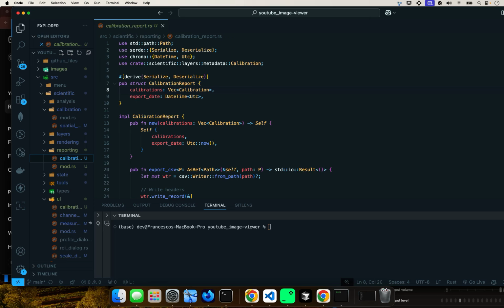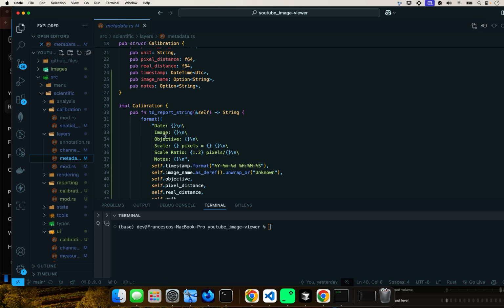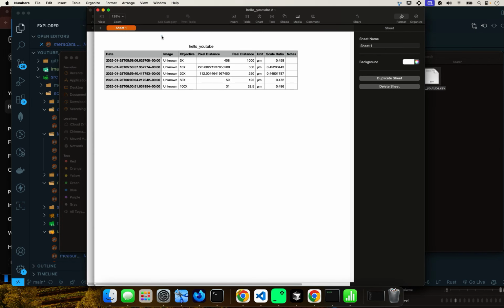Chrono I'm also using from the Cargo.toml file. We used it before. This gives you the time, the universal time coordinate, UTC time. And we're bringing in the crate from layers metadata, which is right there. And we're bringing in calibration, and we saw that in the last tutorial, I believe. And we're bringing this guy. This implementation here gives you the date, the image, the objective, scale ratio, and notes. And if you look at the report, that's exactly what you see here.